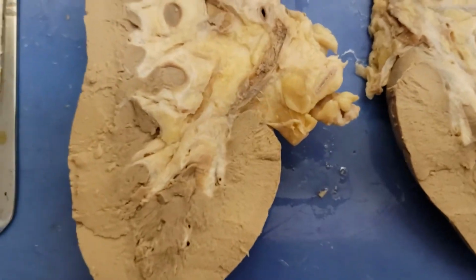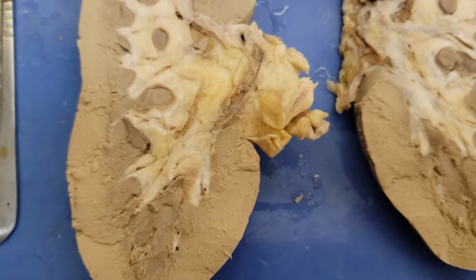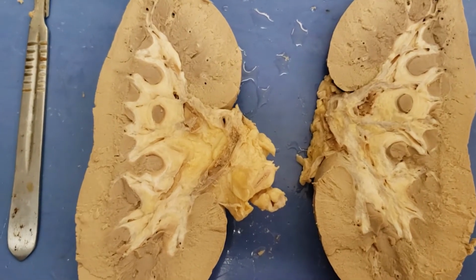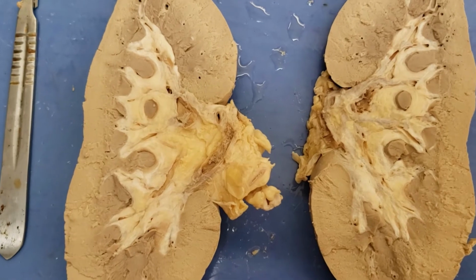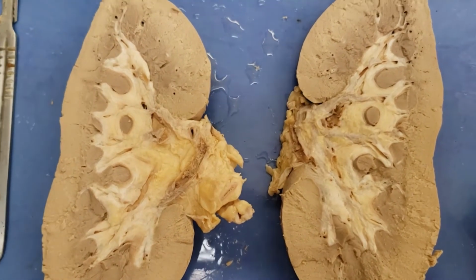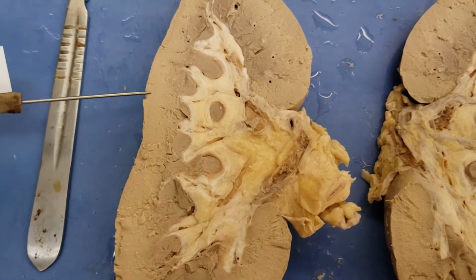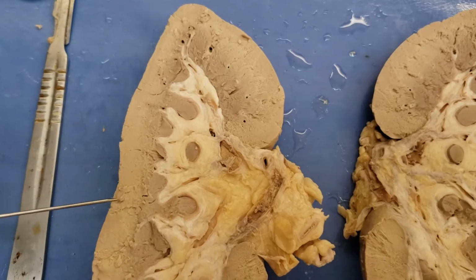So the cortex, it exists. Within the cortex are these things called nephrons. So nephrons are the functional and structural unit of the kidney. Kidneys can only do their thing with nephrons. That's what makes them do their job. They're kind of like neurons are in the nervous system, right? The main drivers, that's what nephrons are. So when blood is filtered, it's filtered outside in this more cortex region, so out here. So this is where they start to receive the blood. Kind of in that, well, it's a little more on the outside, but yeah, we're good. Don't worry about that too much.